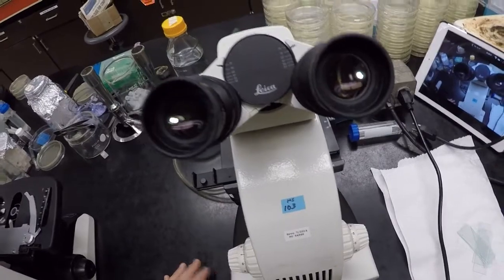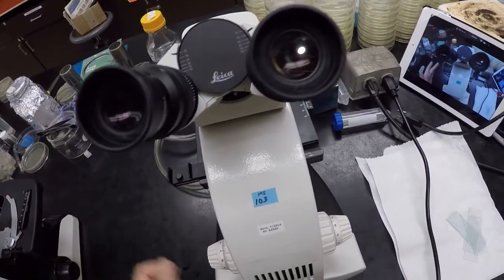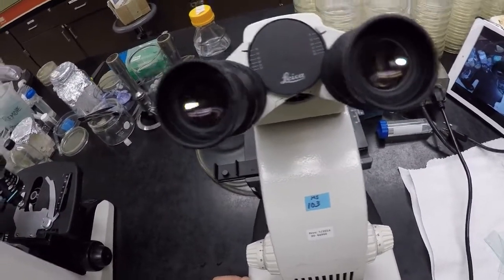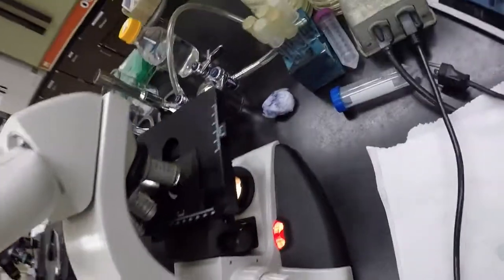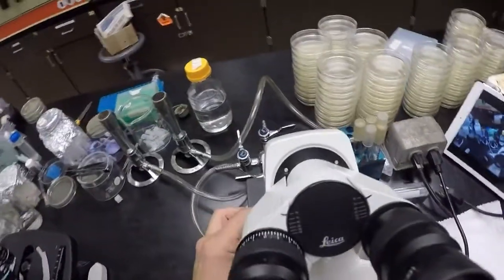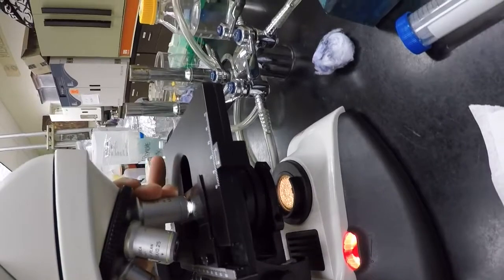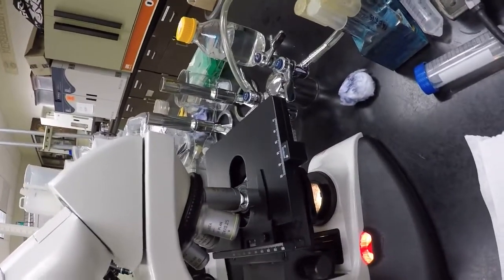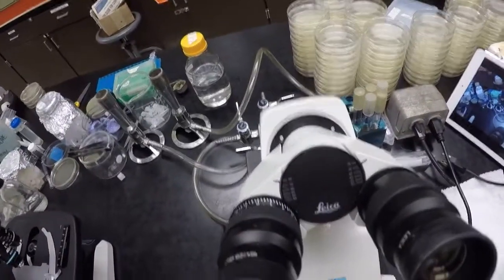Okay, now we are at 10 times 10, 100 times total magnification, right? But again, that's still very small for bacteria, so we want to bring in our 40 times lens. And again, we want to watch it go in. And our 40 times lens should sit just above the slide, right? So when you bring it in like that, it'll go just very tight above there. Shouldn't touch the slide, but it'll come just right above the slide, right? It's kind of a scary lens to put in, and that's why you must watch it.